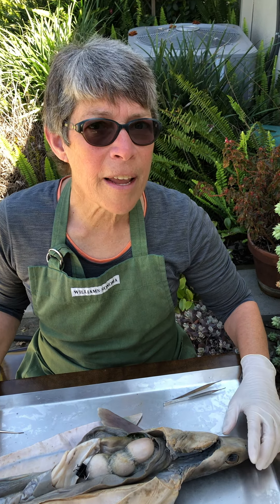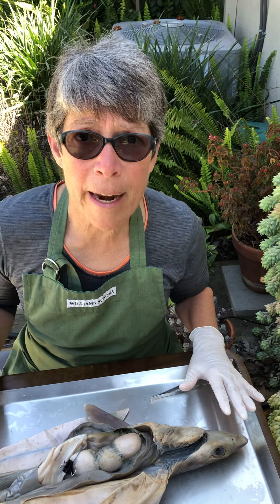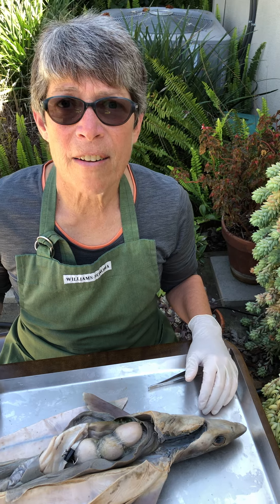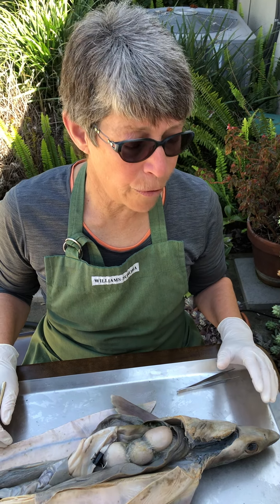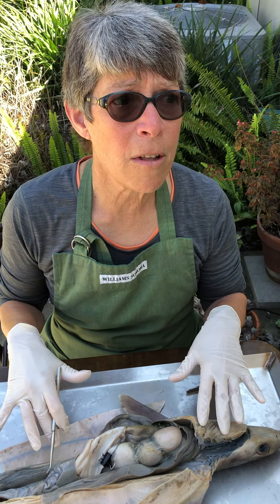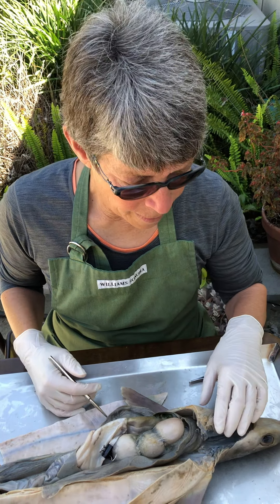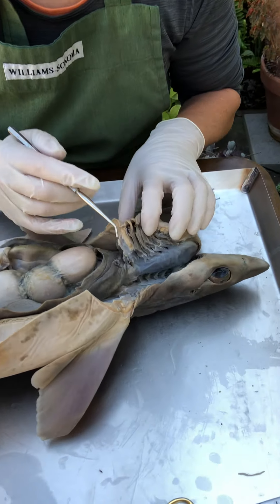Now that we're into the internal anatomy of the shark, we can go ahead and take a tour of the digestive structures. We're just going to go mouth to anus — the alimentary canal and accessory organs as well.